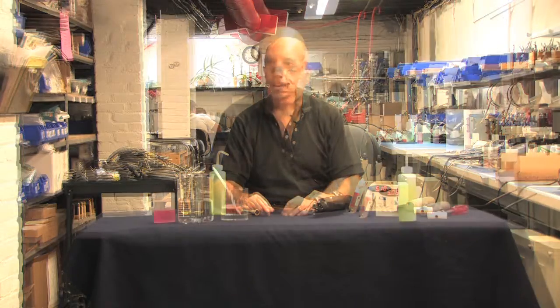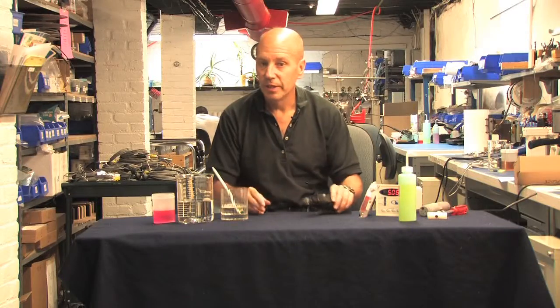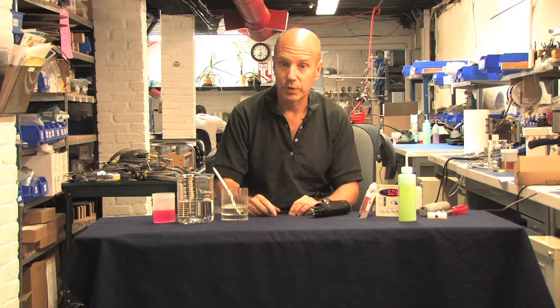When you do change the salt bridge, remember you have to change the reference solution too. And as with all maintenance, you have to recalibrate the probe. One last order of business when maintaining a differential probe is cleaning the electrode. This is the glass bulb that sticks into the process. If it becomes coated, your probe will become sluggish and its efficiency will drop.